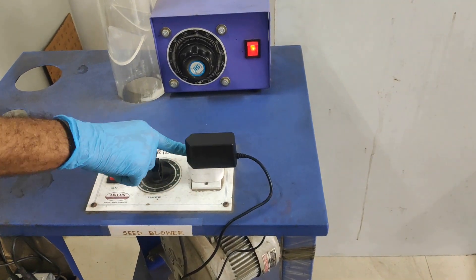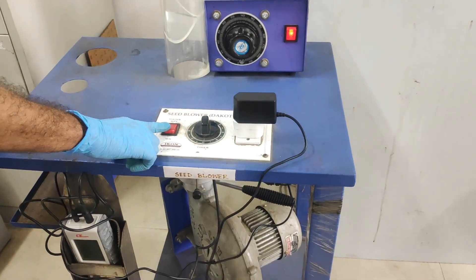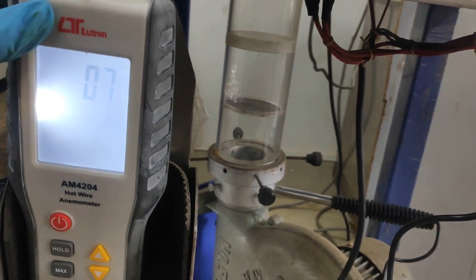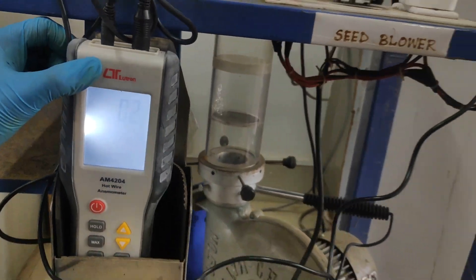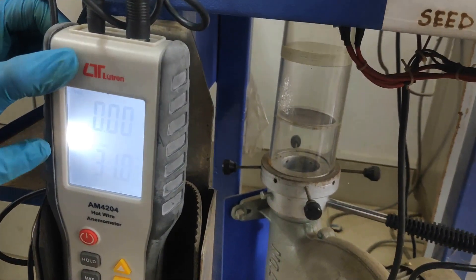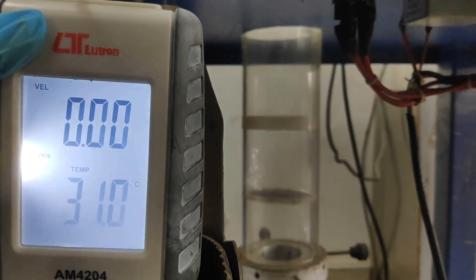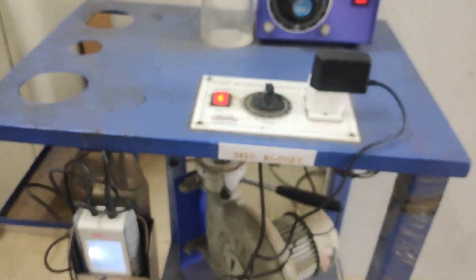We have inserted an extension which converts the American socket to Indian, and it is inserted. Now switch on the machine and switch on the anemometer. We can see the temperature is 31 degrees Celsius and the wind velocity is 0.00, since the machine is off. Now let us put the sample in the column and switch on the machine.